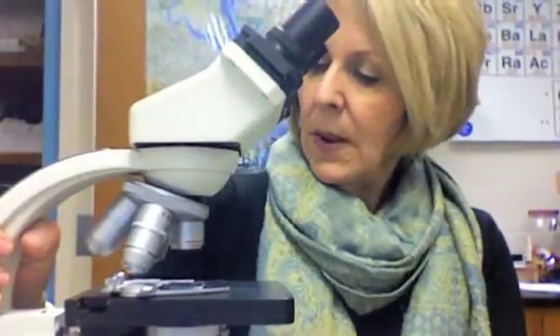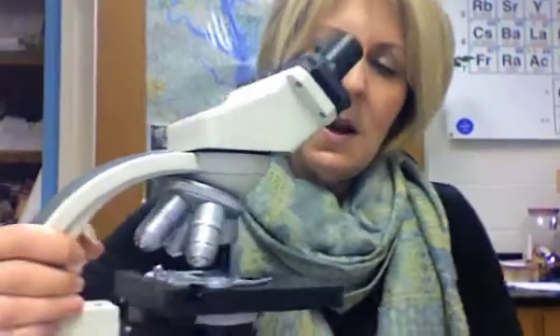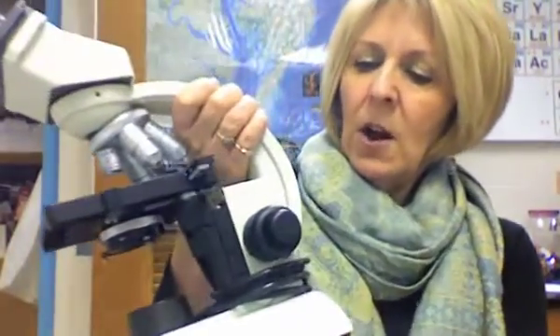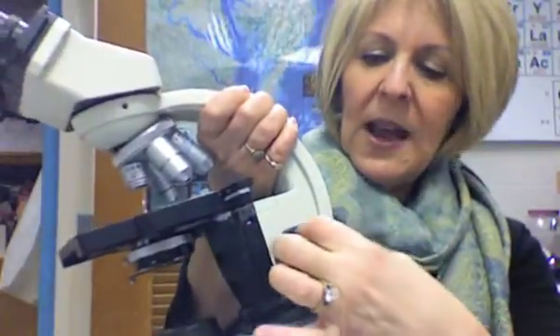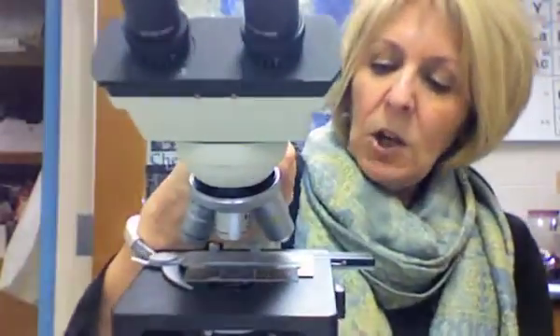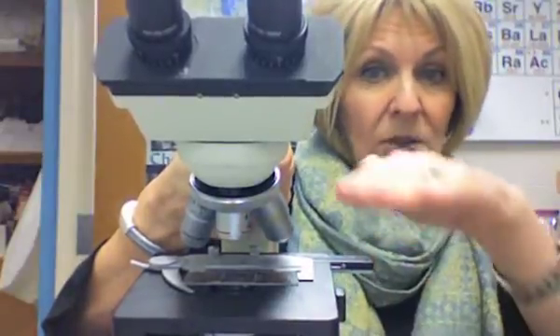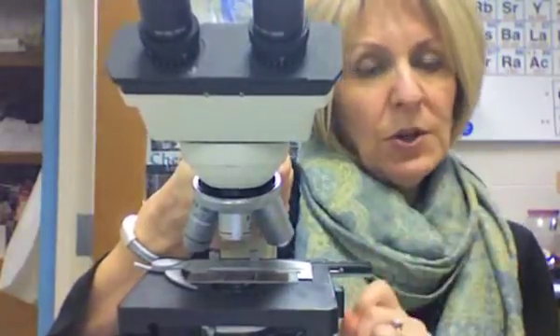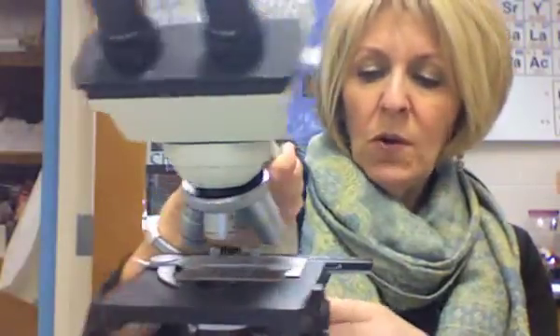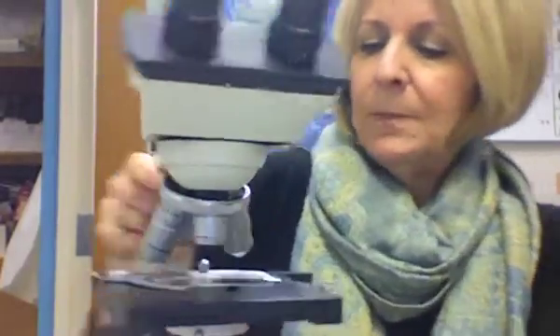Let me show you the coarse adjustment and fine adjustment knobs. The big knob is the coarse adjustment and the smaller knob is the fine adjustment — sometimes they're on the same knob, sometimes in different places on the microscope. Notice what happens when I move the coarse adjustment: the stage goes up and down. So what you want to do is move the coarse adjustment to raise the stage up until it will not go any further — but don't force it.